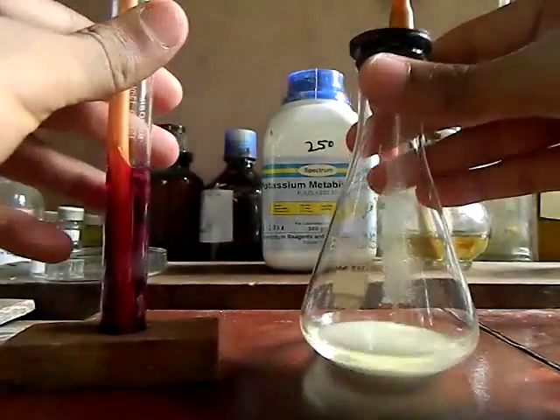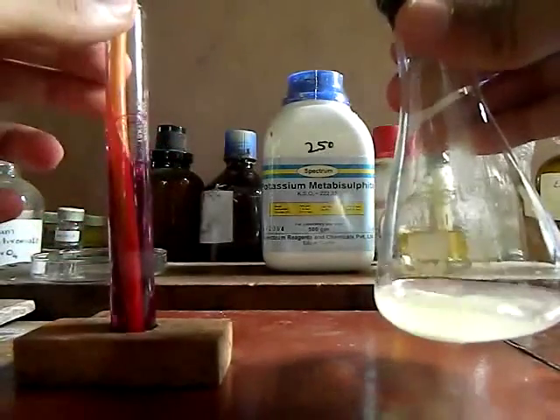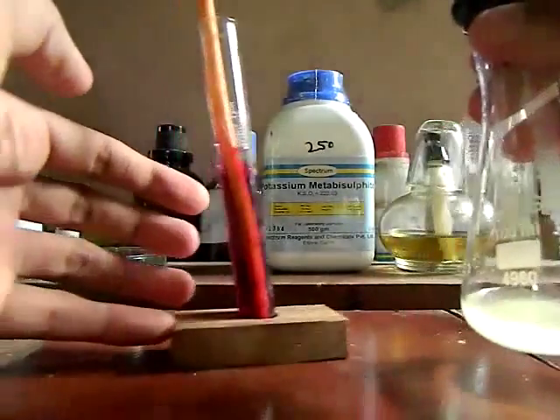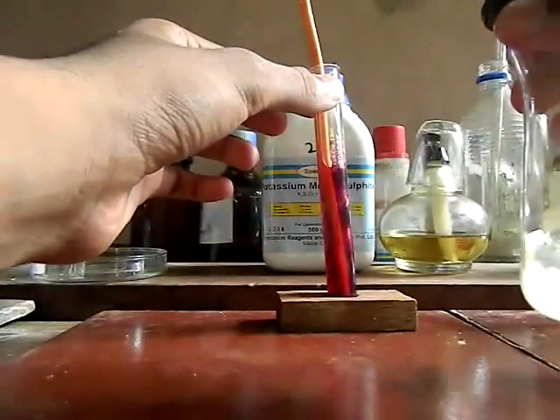Here I am adding the acid. You can see the brisk effervescence and the formation of gas. Here you can see the bubbles in the potassium permanganate solution.